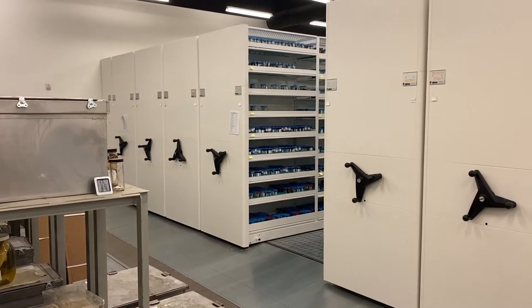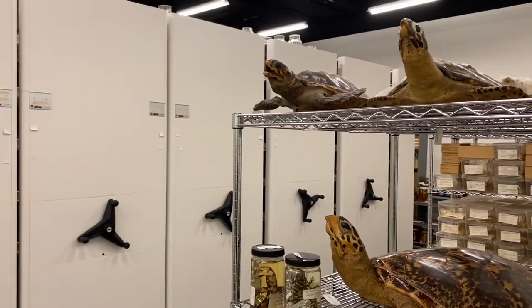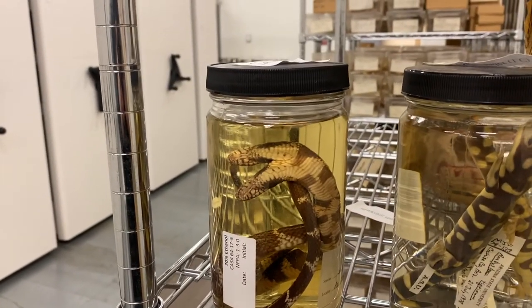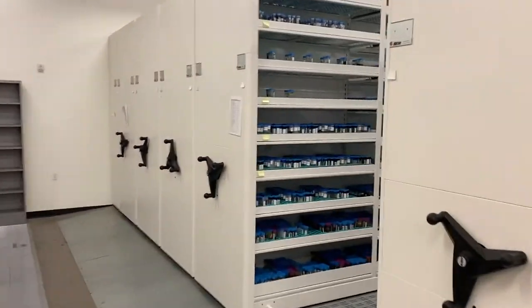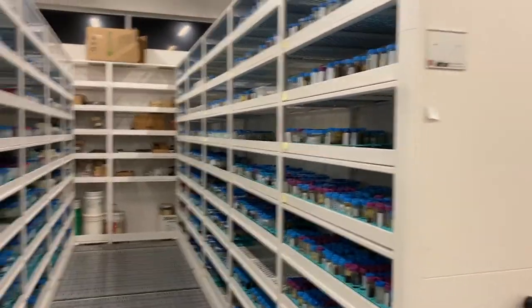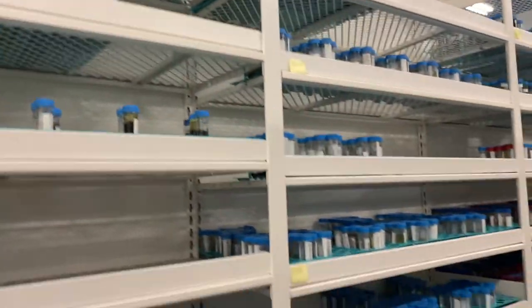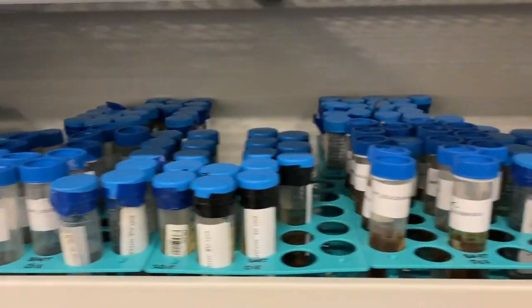To continue our tour of the NEON Biorepository and invertebrate collections, we come to the Ethanol Compactor of the Arizona State University Biocollections. This compactor is primarily full of jars of ethanol containing reptiles, amphibians, and fish. But over here we can find an aisle full of tubes collected from the pitfall traps of the NEON Biorepository, containing all of the invertebrate bycatch from pitfalls.